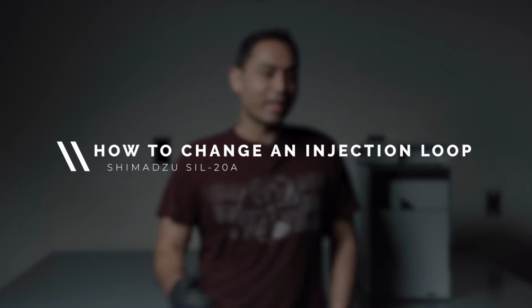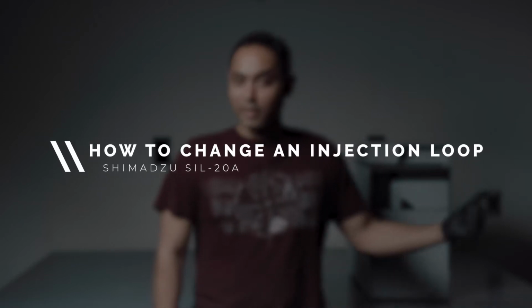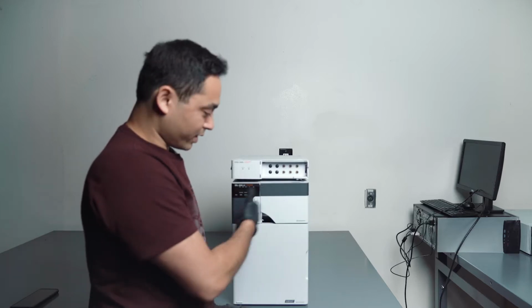Today I got a treat for you. We're gonna be showing you how to change the injection loop on a SIL-20 auto sampler made by Shimadzu. So let's get started. The first thing we have to do is we're gonna need to take off the door.